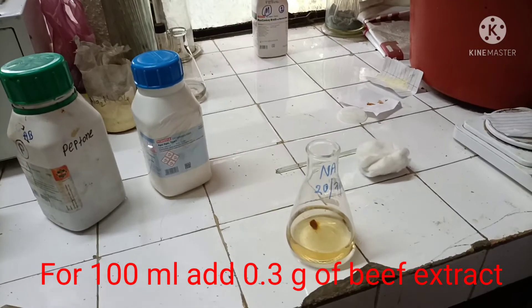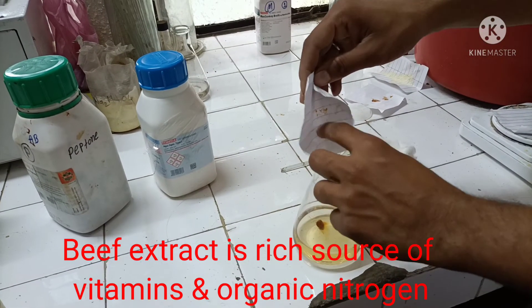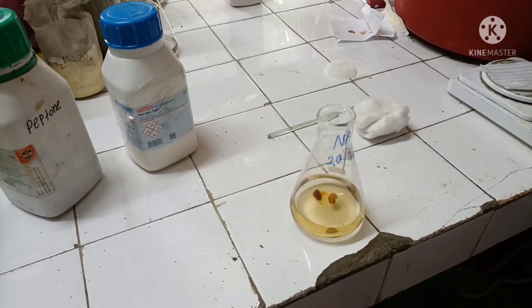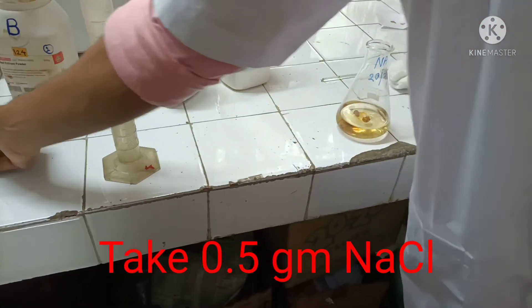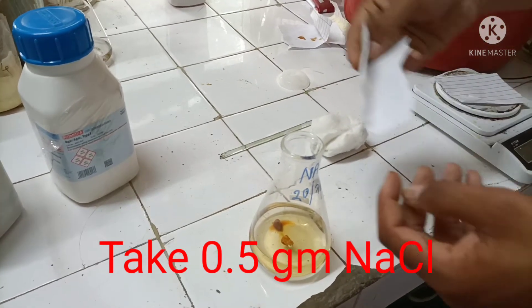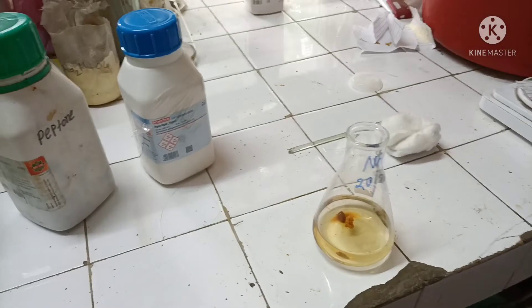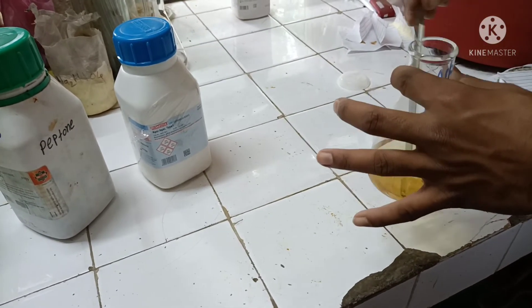Beef extract or yeast extract is the rich source of vitamins, organic nitrogen, and mineral salts, and it stimulates the growth of bacteria. Then we take 0.5 percent NaCl — 5 grams is recommended for 1000 ml, so for 100 ml we take 0.5 grams. We dispense it into the conical flask and mix it properly with the glass rod.